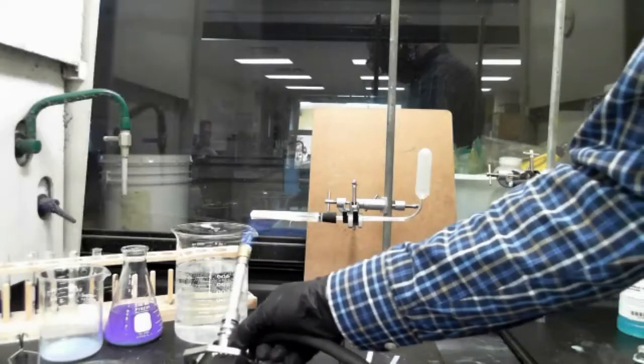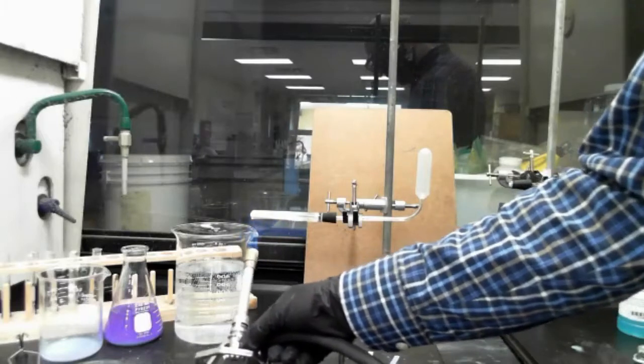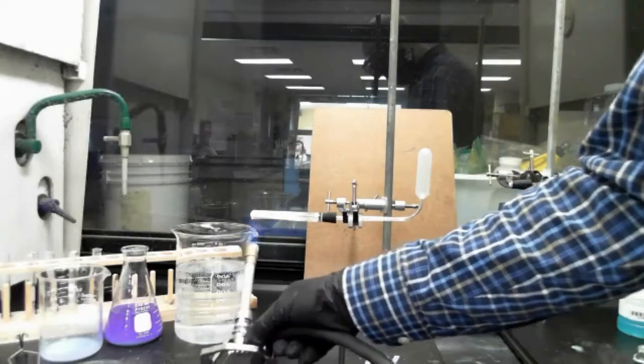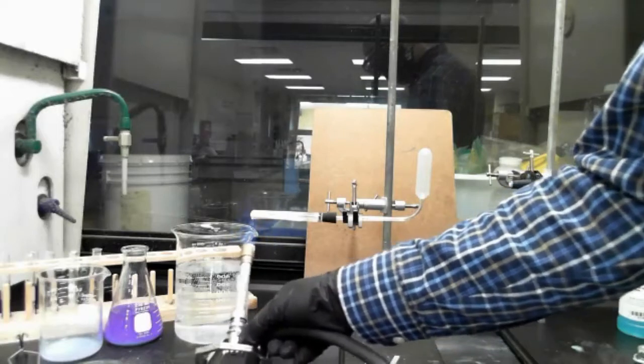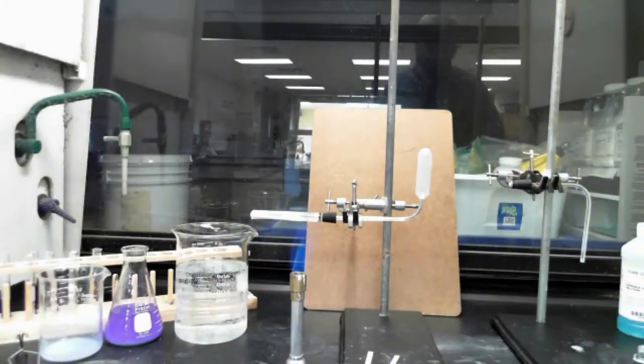All right, and we can't tell because we're not displacing water, so we kind of have to just give it enough time to generate the gas. All right, and I'm done with this one.